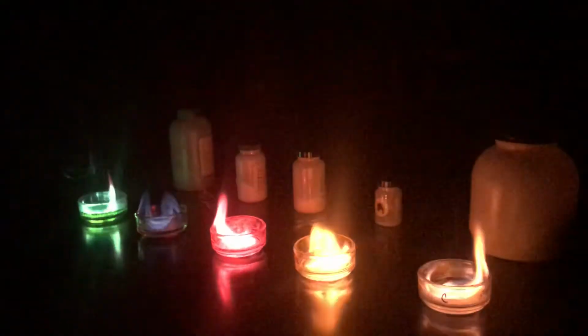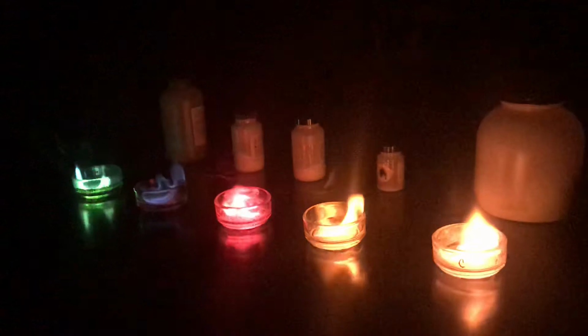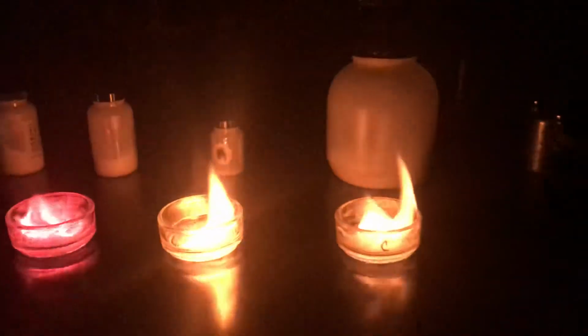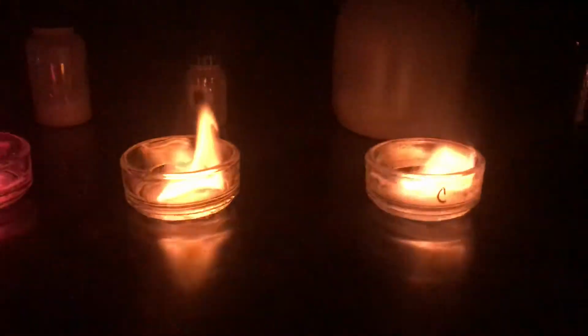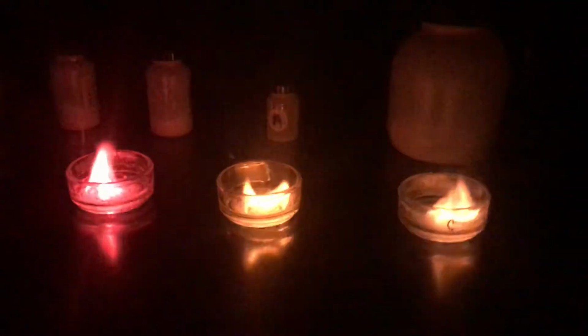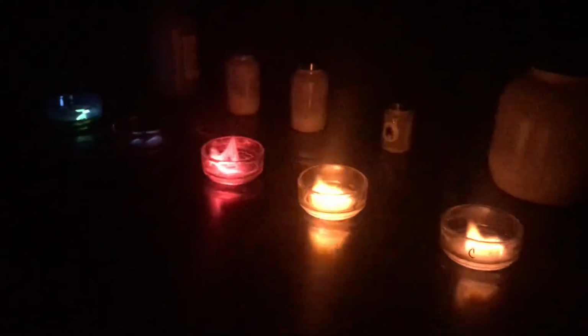As you see this now, you can kind of see the two on the very end there, the potassium and the sodium right next to each other. The potassium has just a little bit lighter color to it than the sodium does, but not much. Okay. We have a hard time seeing the lithium, and that's because I couldn't find lithium chloride. We had to use lithium carbonate, and it just doesn't seem to get energized quite as easily. And this is just an example of why we need to go through and analyze those electron configurations, because no atom is exactly the same as a different one.